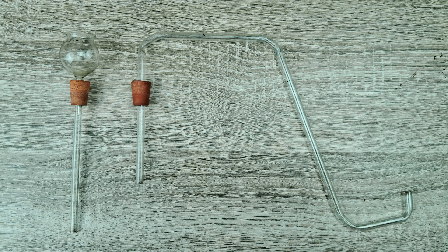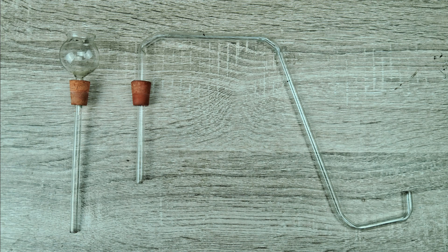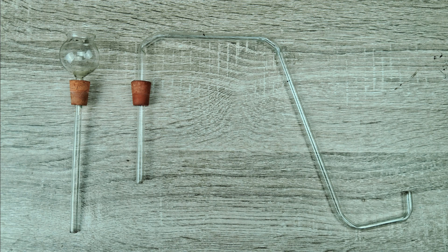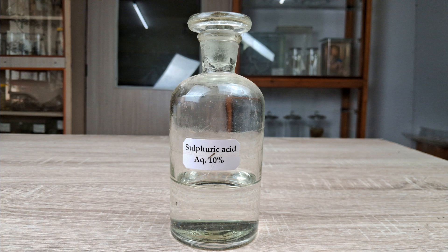Two rubber corks that fit in the two mouths of the Woulff bottle — one rubber cork has a thistle funnel or dropping funnel inserted in its hole, and the other cork has a delivery tube bent in four places. If using a round bottom flask or conical flask, you will need just one rubber cork with two holes: one for the thistle funnel and one for the delivery tube. Also required: zinc granules and dilute sulfuric acid or dilute hydrochloric acid.